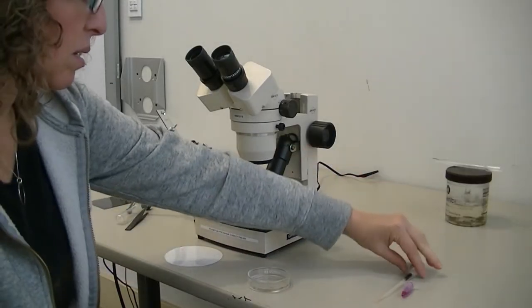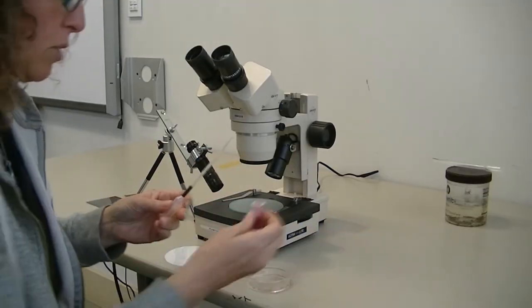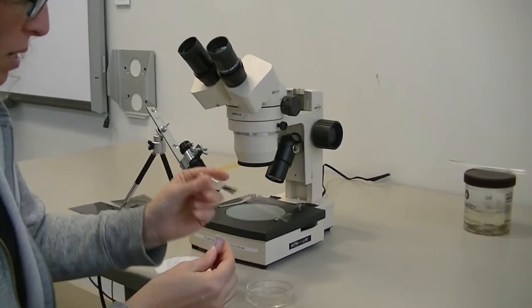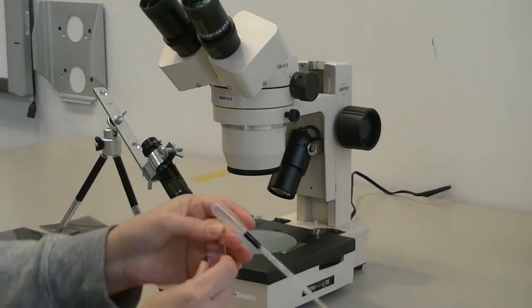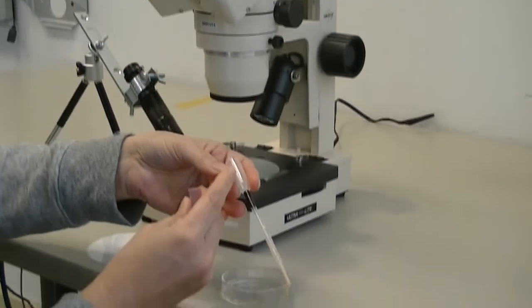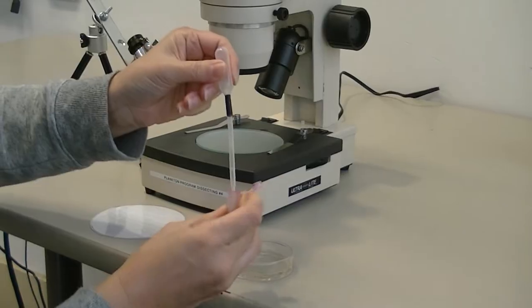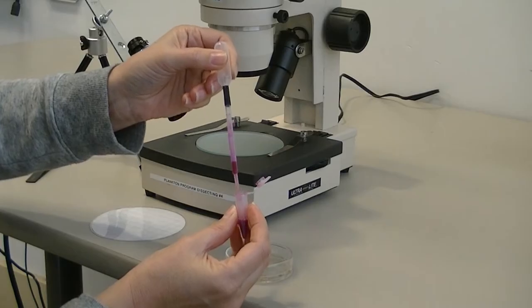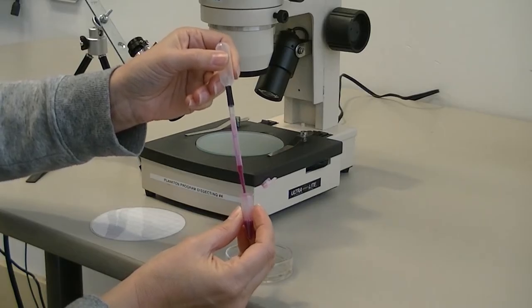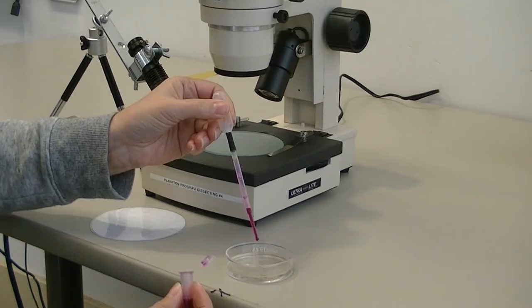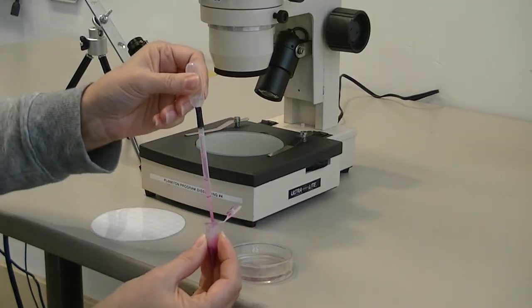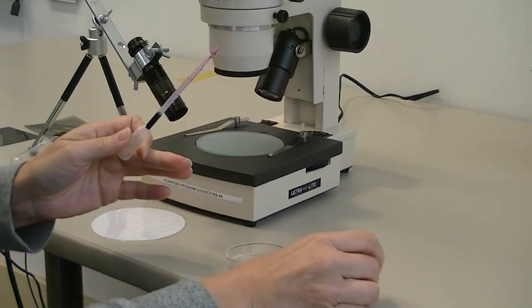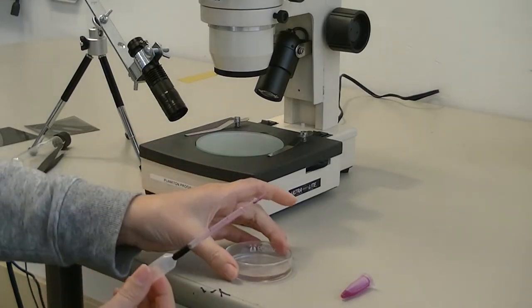The next step is getting your Nile Red dye into your sample. This is the solution. This is our dedicated Nile Red pipette. You just want one drop into your solution. Give it a little swirl.